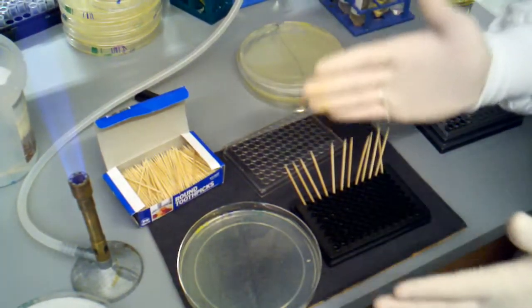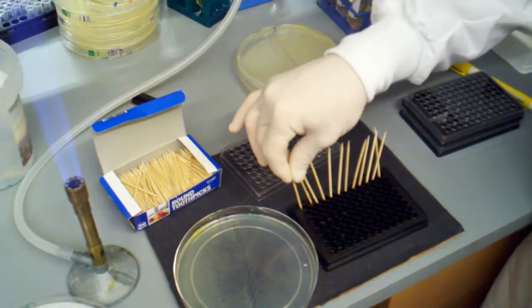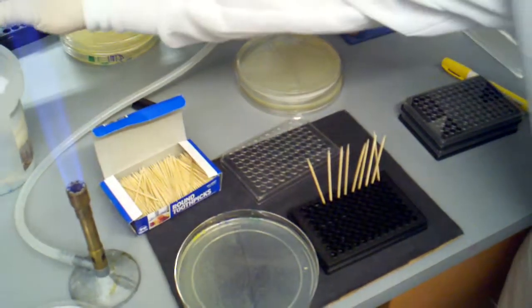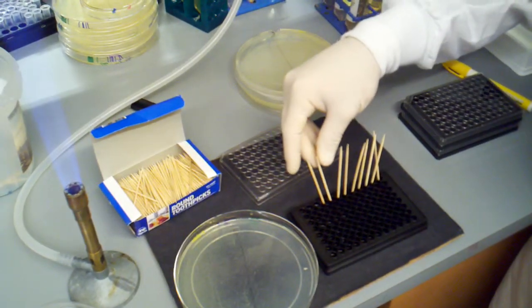So we'll just pretend that we've just filled this entire thing up now. In order to get rid of the toothpicks, I just pull them up two at a time. I got three at that time actually.